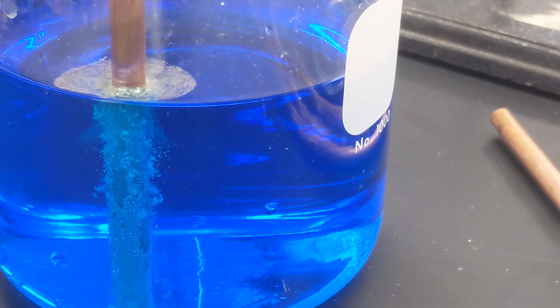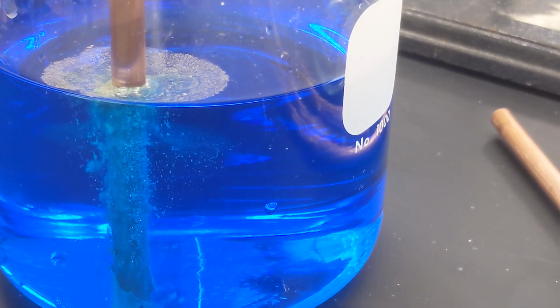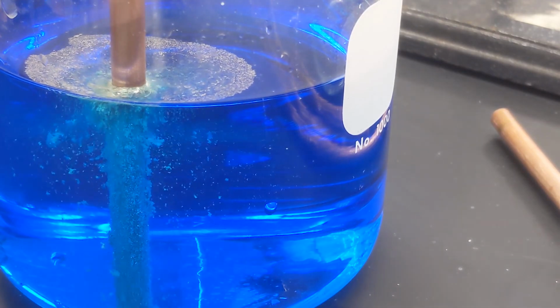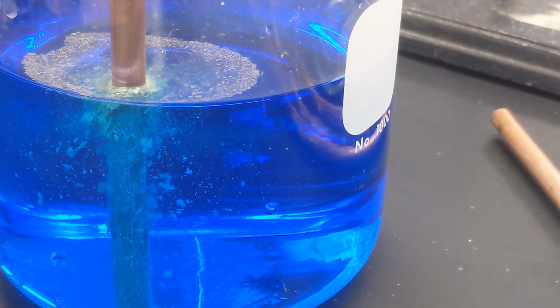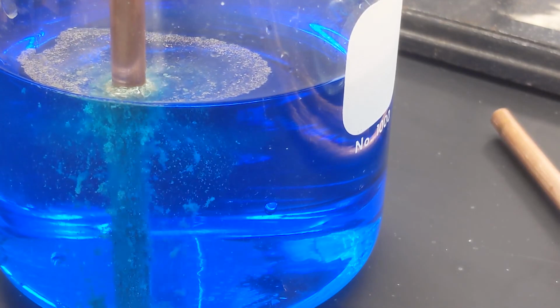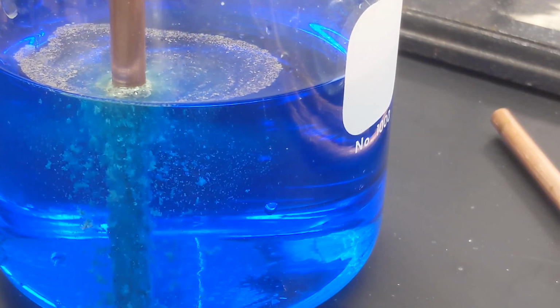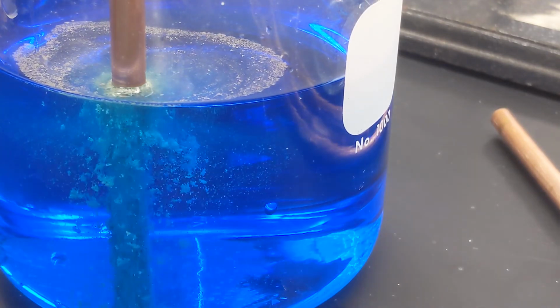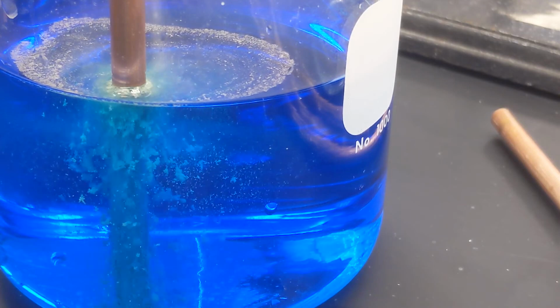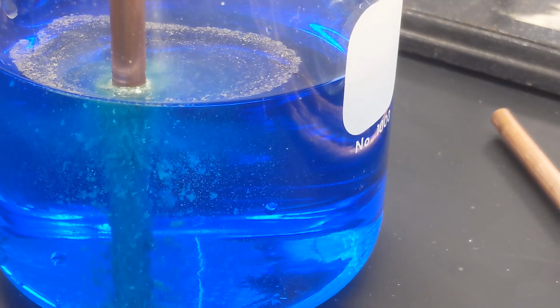Now, if you're a person who pays attention, you might have two questions. One is, how did I get so much of this liquid? And two, why is it actually dissolving again? And the second one is, well, that's because I actually never really neutralized the nitric acid properly. And that's where one of my downfalls was. The silver was dissolving and solidifying, and the copper was dissolving and solidifying, and it was reacting with the acid, and I ended up getting kind of a big mess.